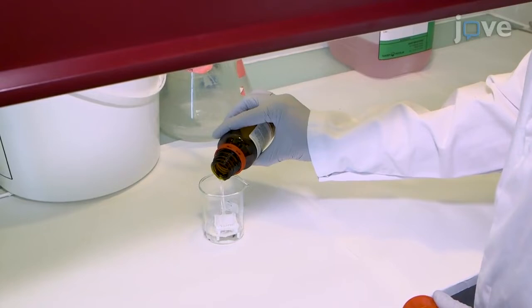Cover the beaker with aluminum foil and leave it at room temperature for three minutes. Meanwhile, fill a large beaker with ultra-pure water.